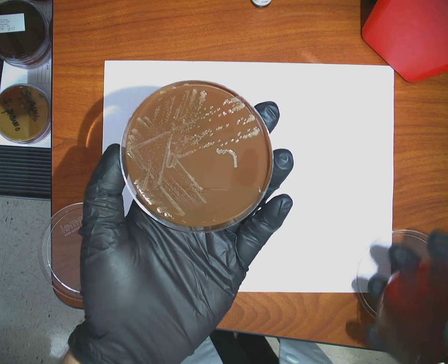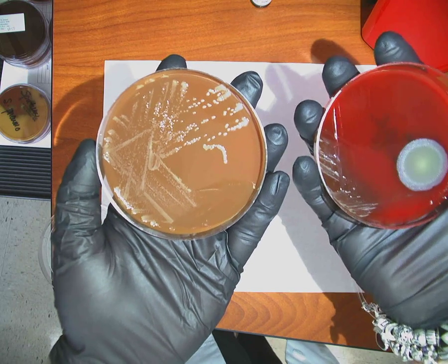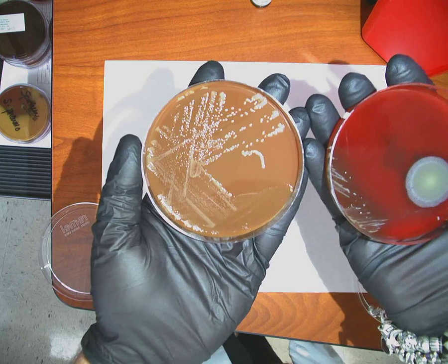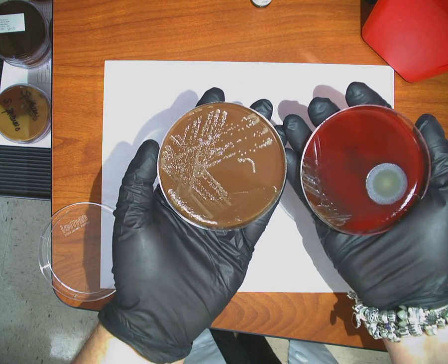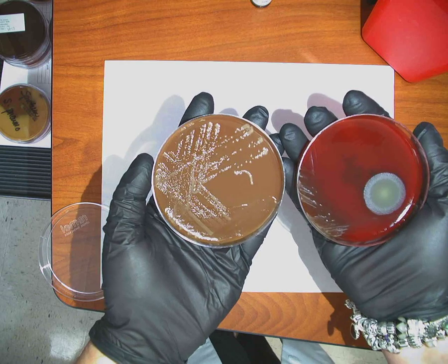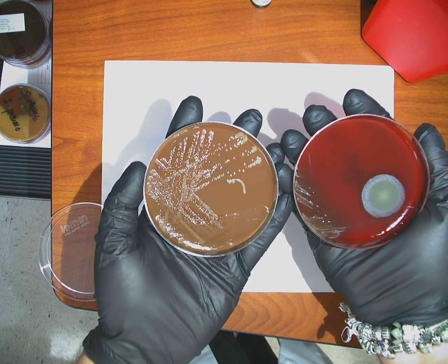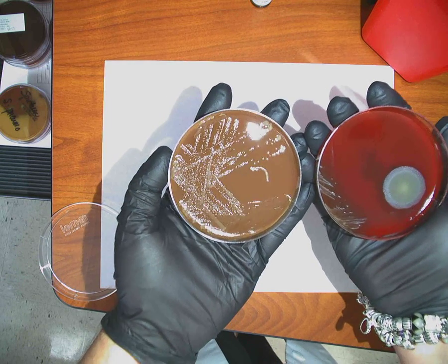Thank you. You know what it is now. What do you know that it's not? Don't worry about this contaminant right here. What do you know that it's not based upon the color of it? It's going to be a tan-colored colony. Okay, so I'll go over it after we finish. Based upon the color of it, the shape of it, the fact that it is growing a little bit on blood agar, we know several things that it's not, so we know which way to go.